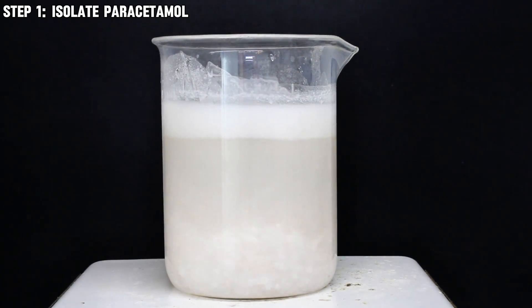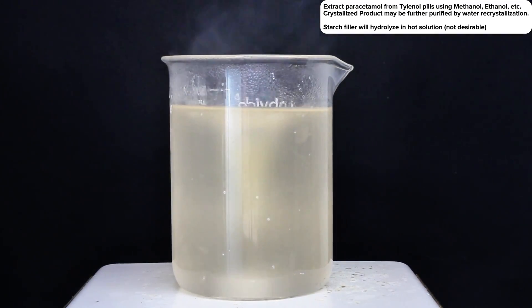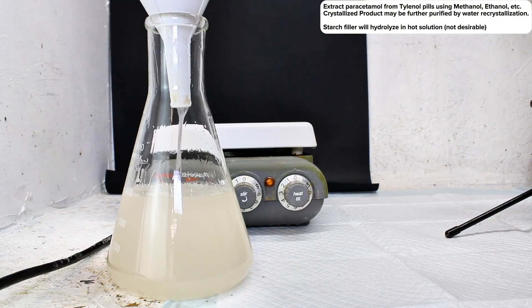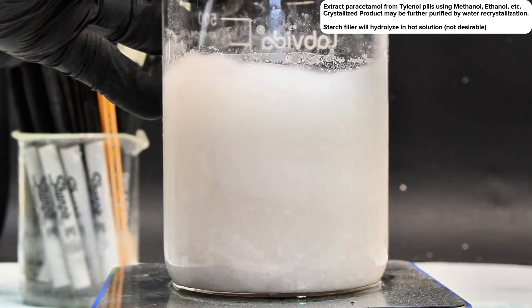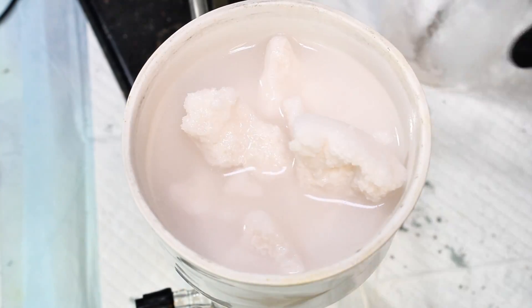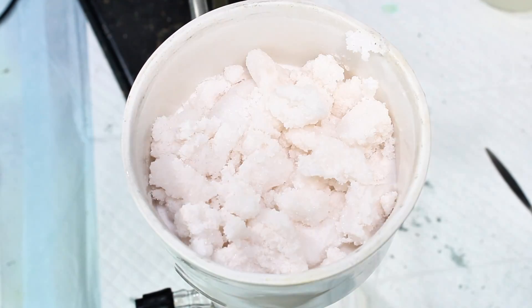I've done this a few times on this channel, and I've generally found the best method varies slightly depending on what types of additives are present in the pill. Generally, this is a two-step process where the paracetamol is first extracted by crushing the pills and soaking the powder in a solvent such as methanol or ethanol to leach out the paracetamol. The pill binder material can then be filtered off, and the filtrate dried to leave a crude product, which in a second step is recrystallized from water. My only note here is that if the pills contain starch, the first step must be done using room temperature solvent, as the starch will hydrolyze and come into solution at elevated temperatures.